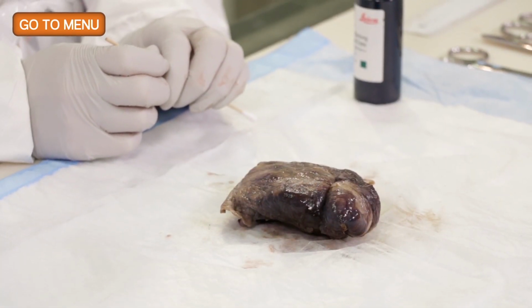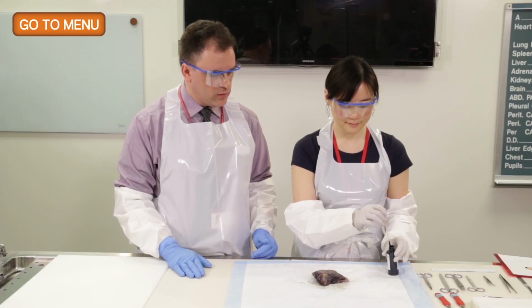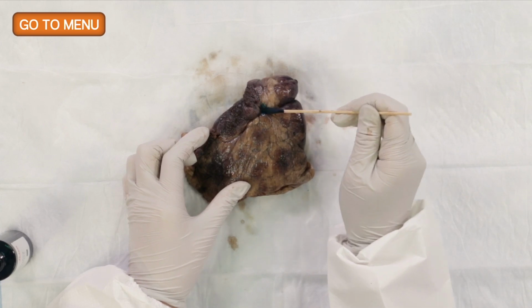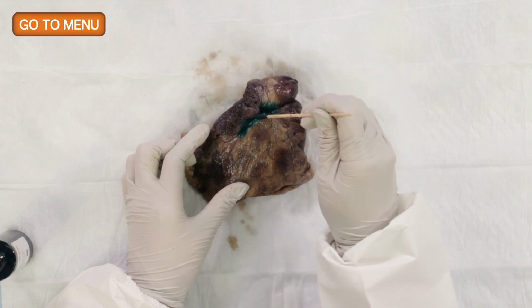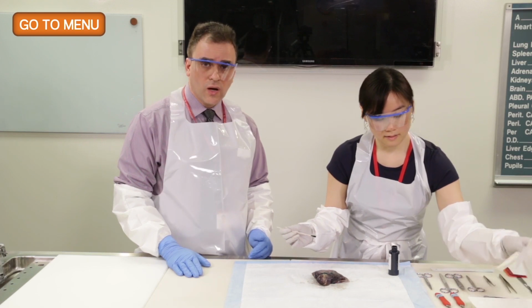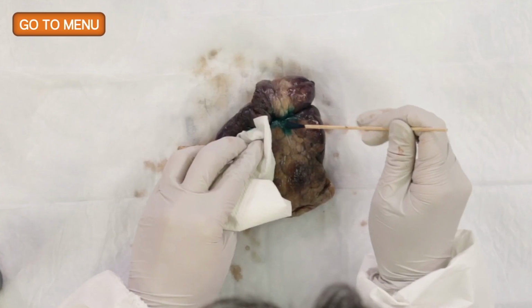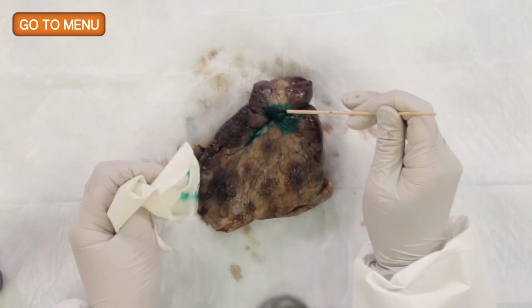And now that you've measured the pleural pucker, you're going to ink the surface of the pleural pucker in order to identify this area so that we can see it in the histologic sections as the tumor surface. Yes. And what we normally do is that we use green ink to ink the pucker. And then for the bronchovascular margin, or if there were a parenchymal margin, we would ink that black. And the purpose of the two colors is so that we can distinguish this later when we look at histologic sections, so that we know what the black ink represents and what the green ink represents. It's important to have these conventions and that they get dictated into the gross description of the specimen.